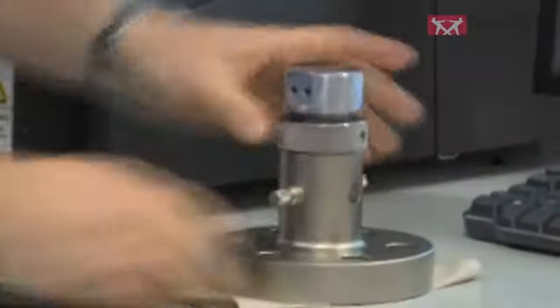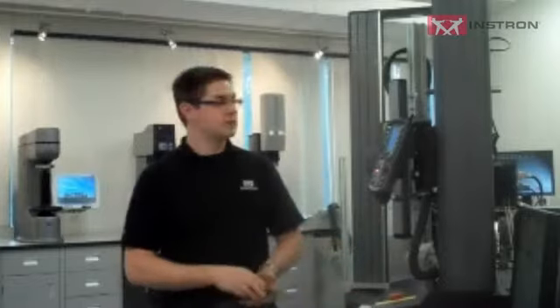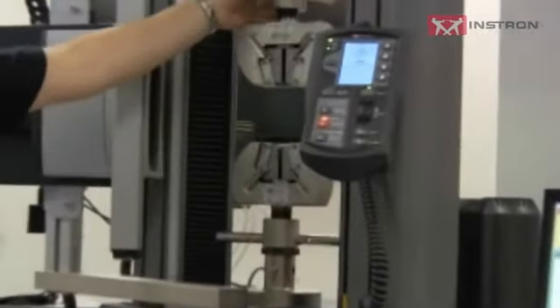Even more importantly, when you're testing at very high loads, everything stretches so the compliance can come back. So what we want to do is get rid of that compliance entirely before our test. In this case, we have a set of mechanical wedge grips. The faces actually move during testing, so we want to make sure that the compliance is completely taken up.